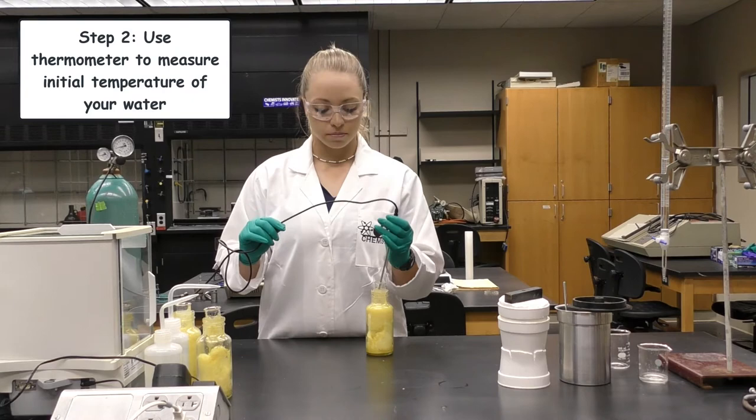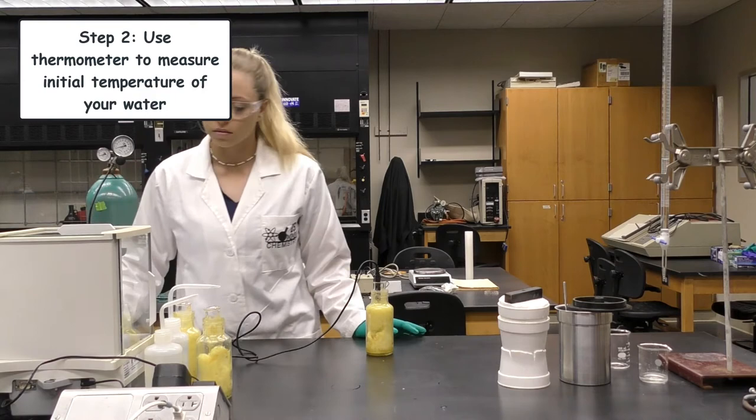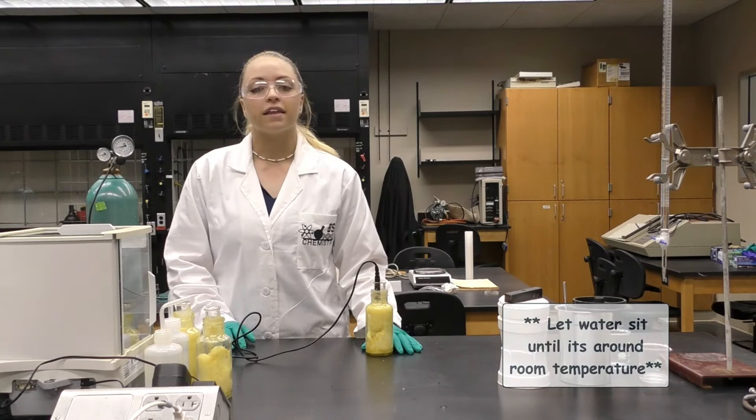You will want to use your thermometer or your temperature probe to take the initial temperature of that water. Our initial temperature is around 19 degrees Celsius.